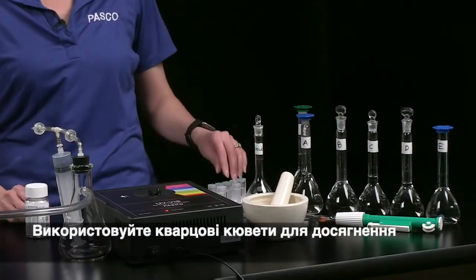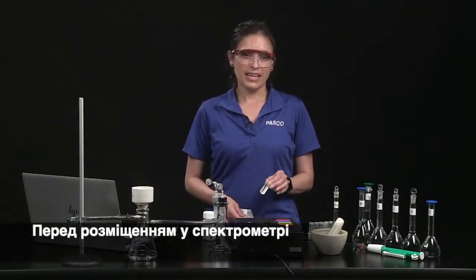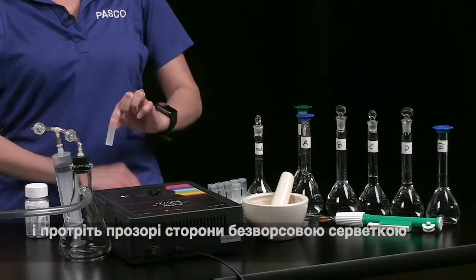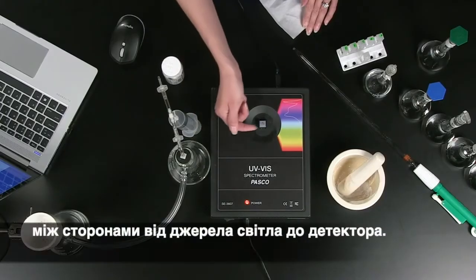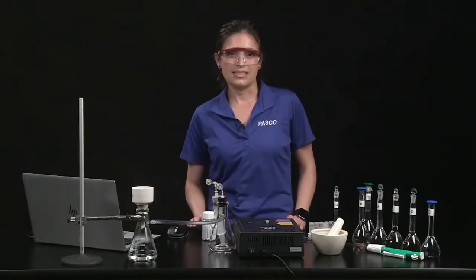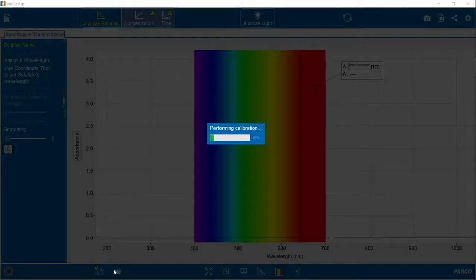Use quartz cuvettes for best results. Fill each cuvette 3/4 full. Handle each cuvette by the frosted sides and wipe the clear sides with a lint-free lens wipe before placing in the spectrometer. Orient the cuvette so that light travels through the clear sides from the light source to the detector. Start with the calibration solution. First, calibrate dark, then calibrate light.